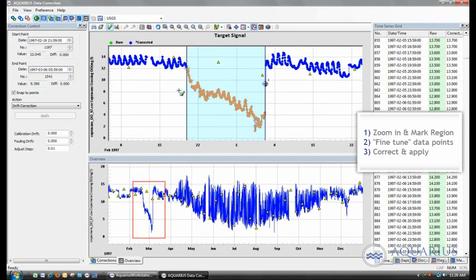Now, obviously there'll be some sort of reasoning behind this. I'm doing this as an example, so the dates to me are not that important, but we can fine-tune the dates and say, okay, we want the end date to actually be this data point right here. So these are the data points that are given this kind of number, and they can also be found here. So if I click the down arrow until it stops right there, so we know that it's from this region to this region. Actually, if I increase that a little bit and move that back, okay, there you go.